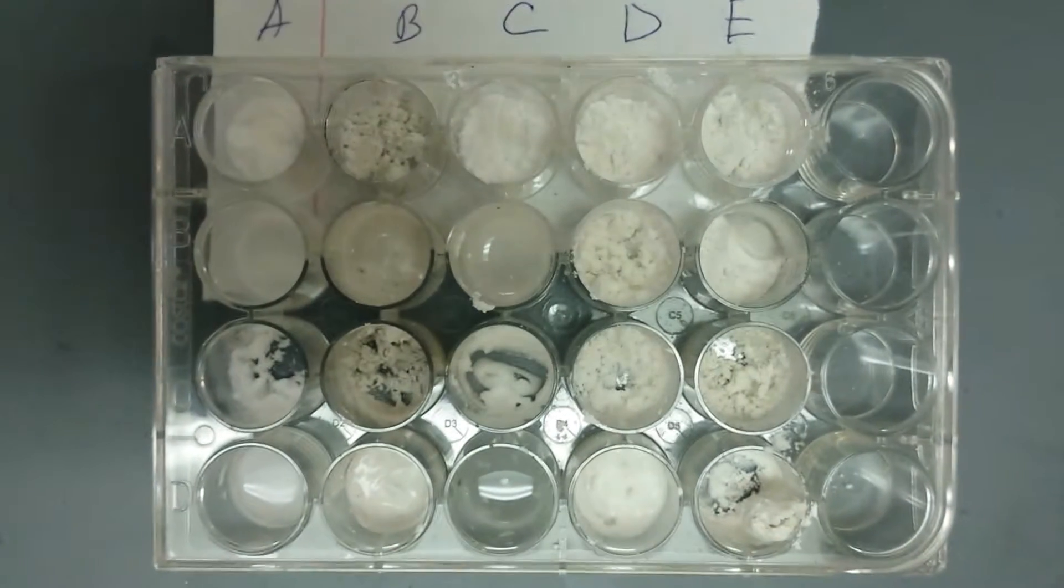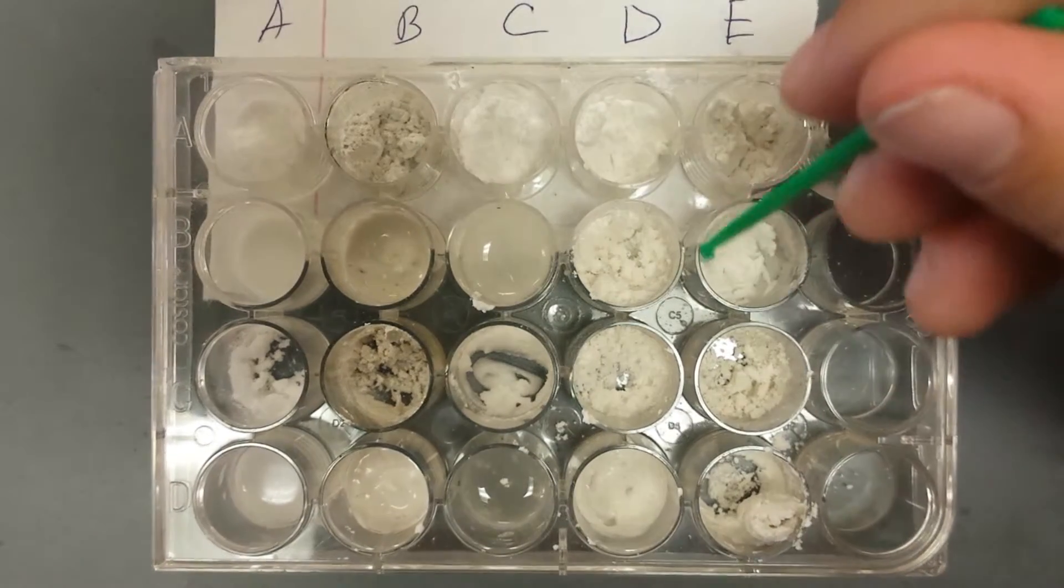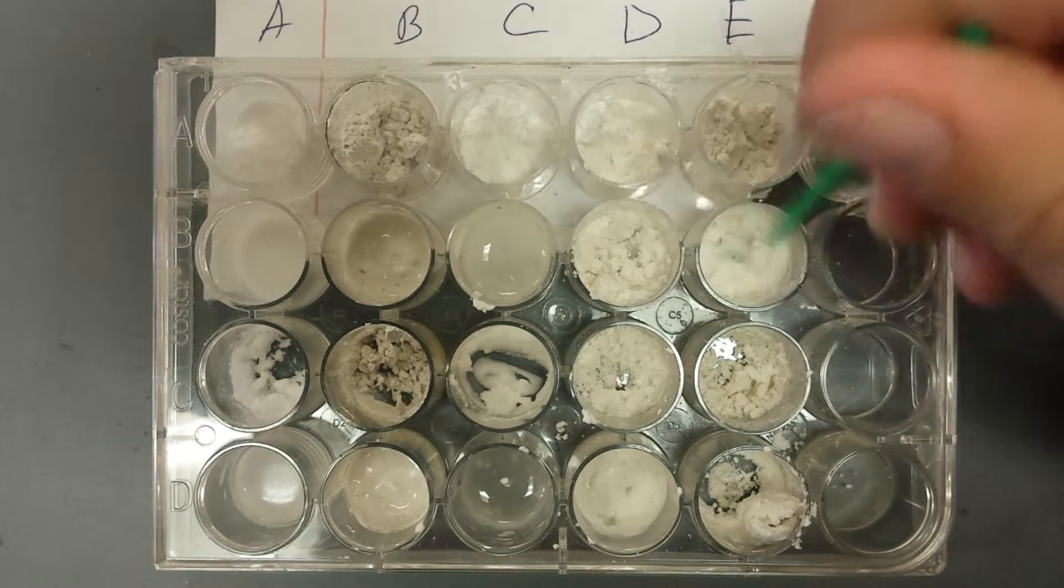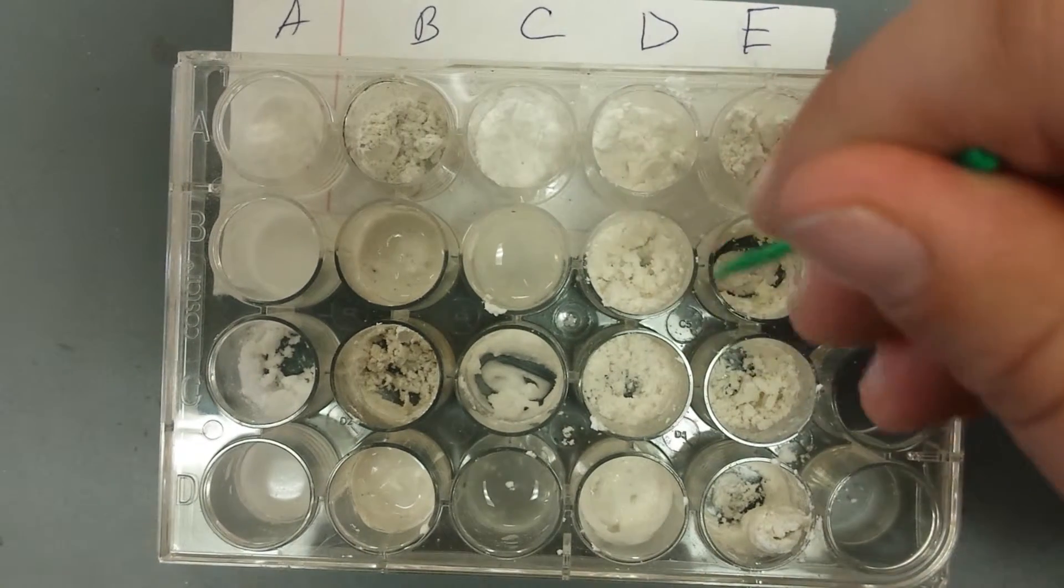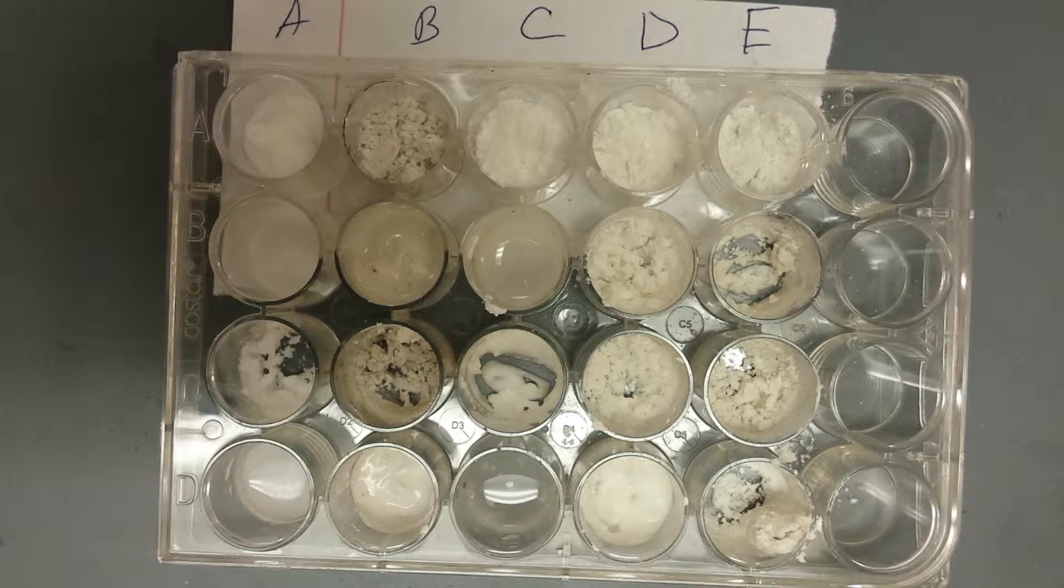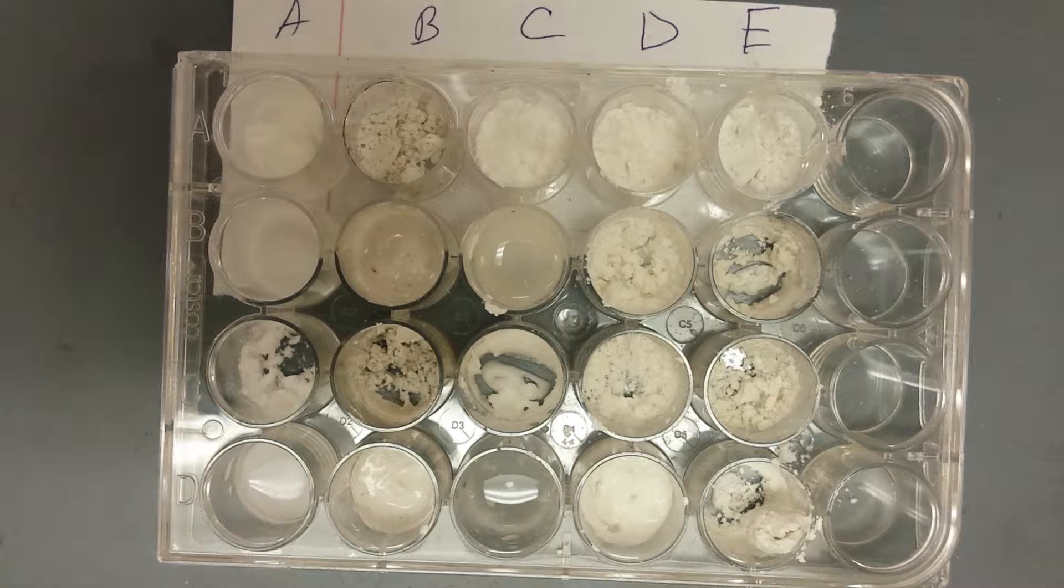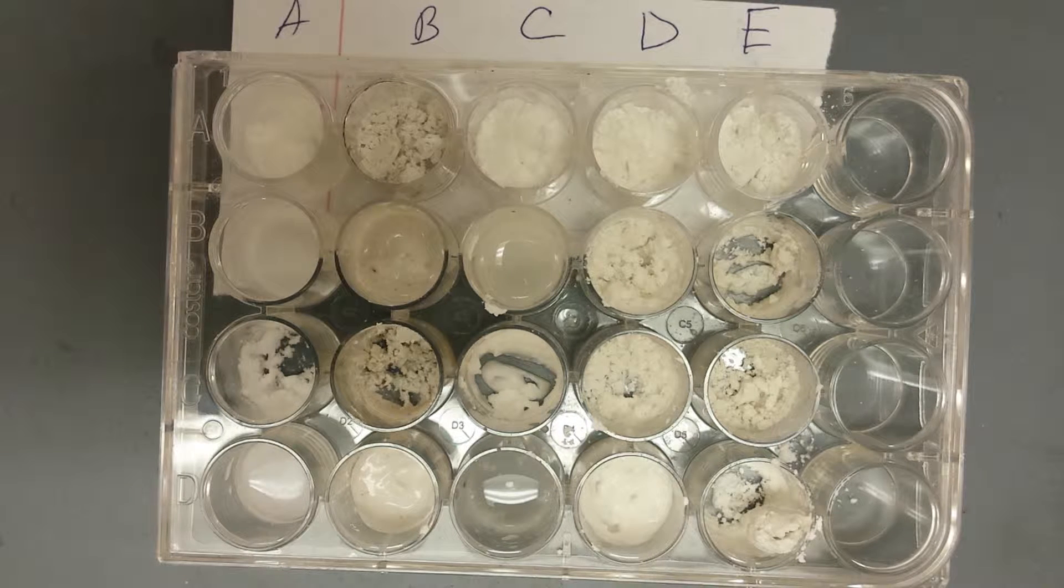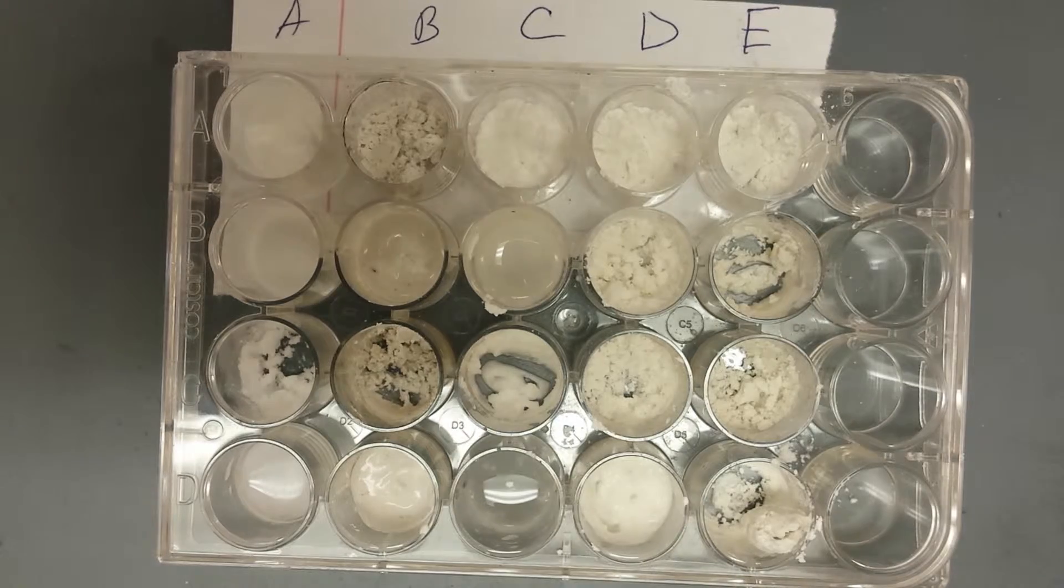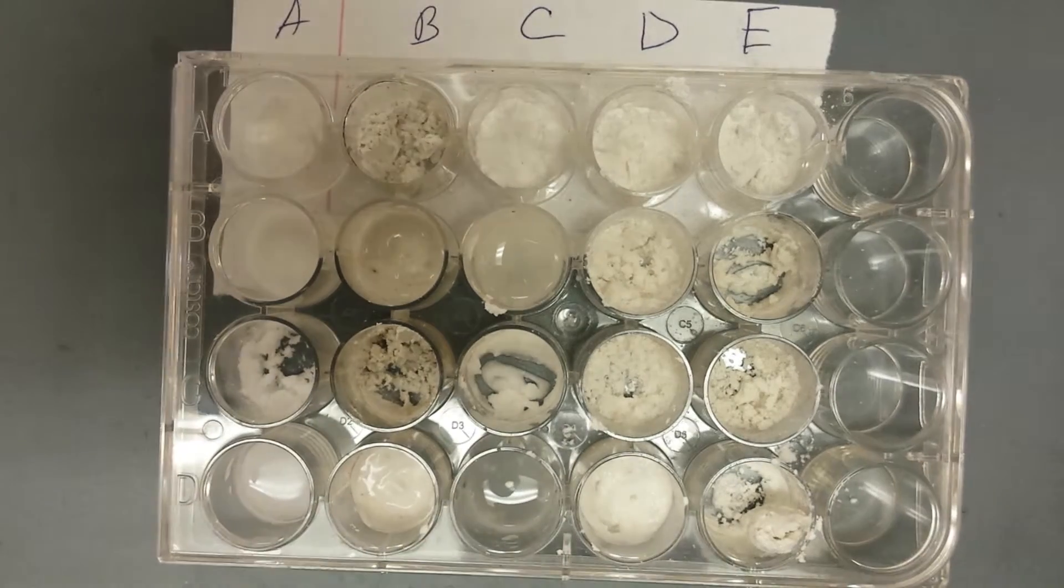Okay, and then E. Hold on, I want to go back and look at A. Like, because most of it's gone. Most of it's gone now, which is really weird. Now we have E. I think it just clumps, like sticks together, makes a paste. What's it doing? Nothing, and then makes paste. Wait, what did we do for C? C dissolved, like it dissolved in the... Okay. And then we have universal indicator.